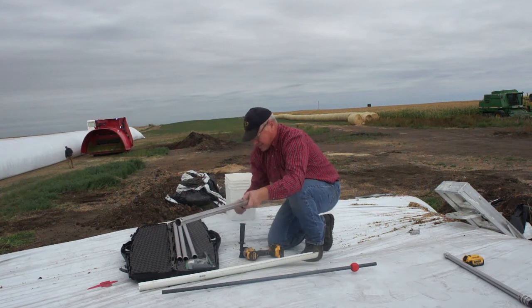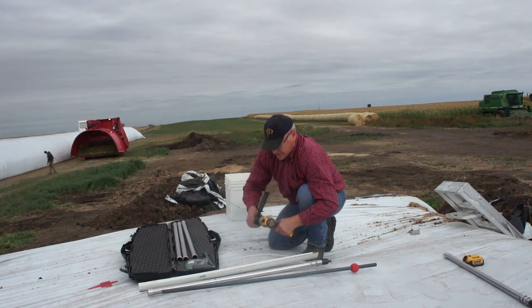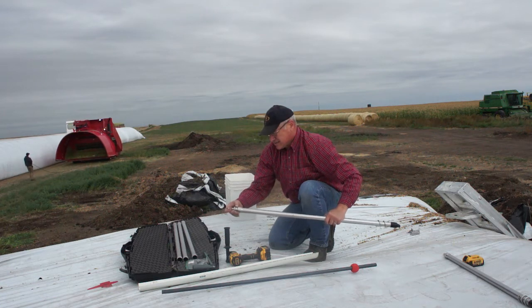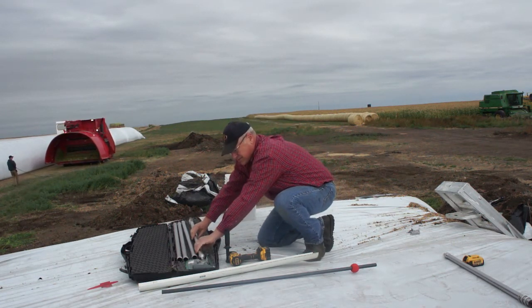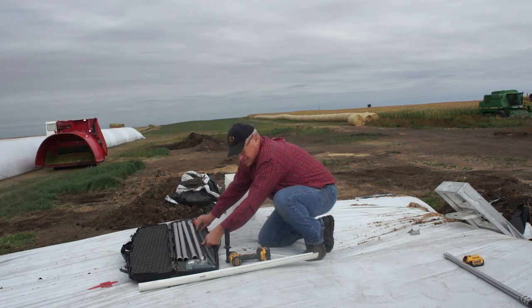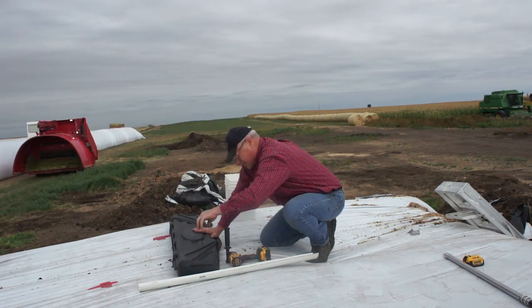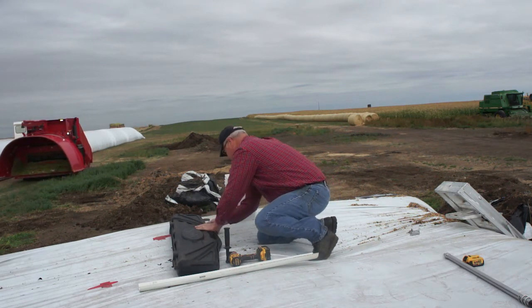If you're going to be doing more sampling right away, you can put things away and move on to the next pile. If you're putting it away for very long, you'll want to clean the probe with water — preferably hot water. You can put a rag on the end of your stick and poke it through the middle to clean that out, then wipe the outside. If you don't wipe it off, you'll find more resistance when you go to drill the next one — it'll be harder to drill and harder to clean the sample out.